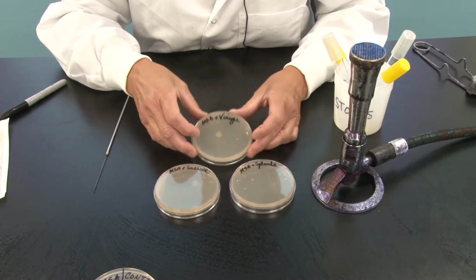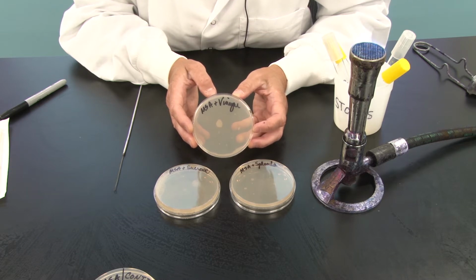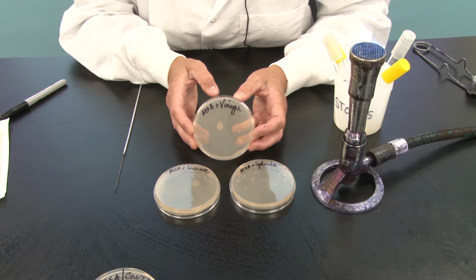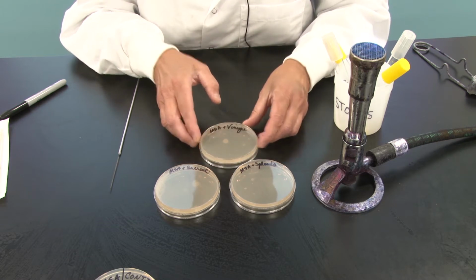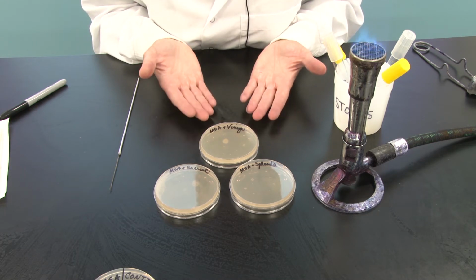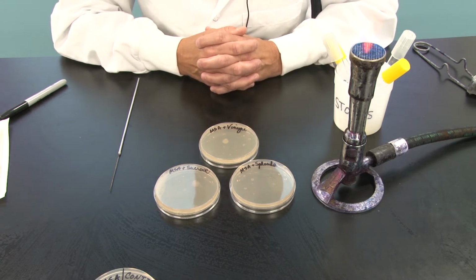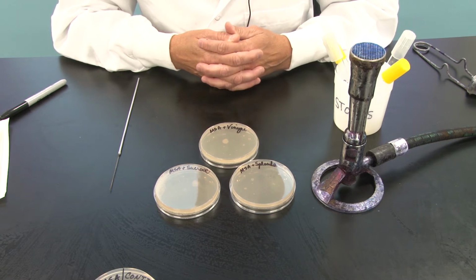And then finally, we grabbed white vinegar and we placed that in the minimal salts agar. So we actually found 3 carbon sources that you commonly find in your kitchen, and we added them to minimal salts agar, knowing now that there is carbon, the element carbon, available for heterotrophic bacteria. The question is, can they use all of these carbon sources to build the backbones for their macromolecules and hence their cell structures? We'll find out. The carbon's there, but is it actually in an accessible form for their metabolism?